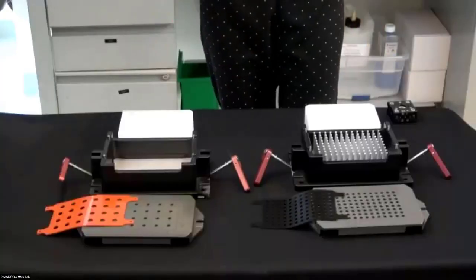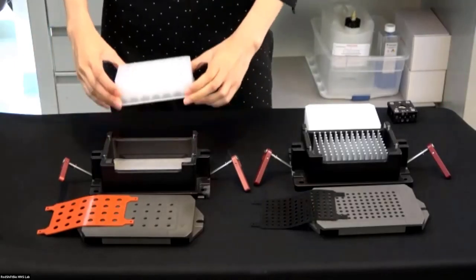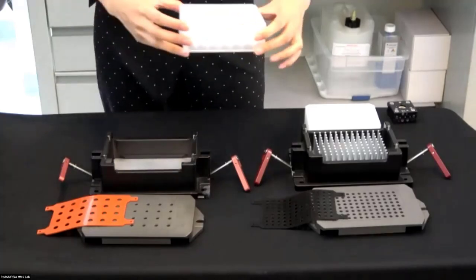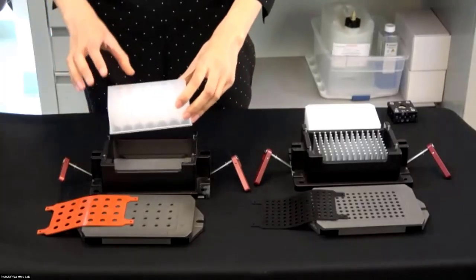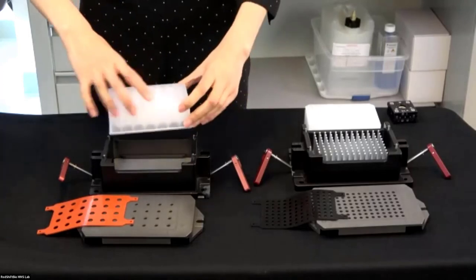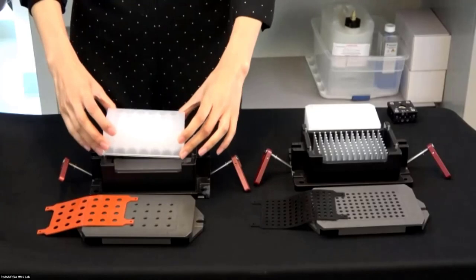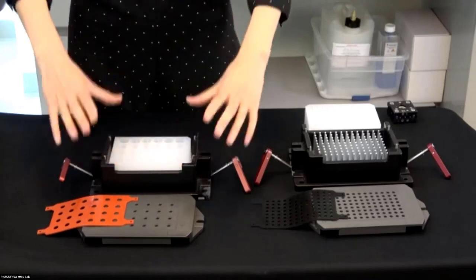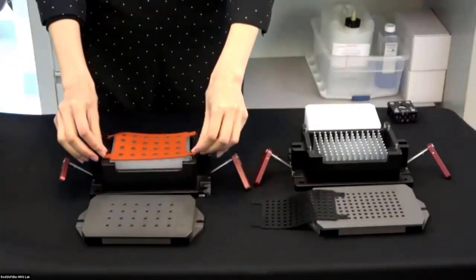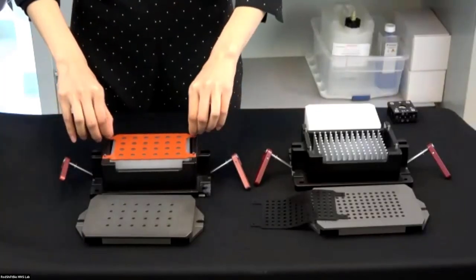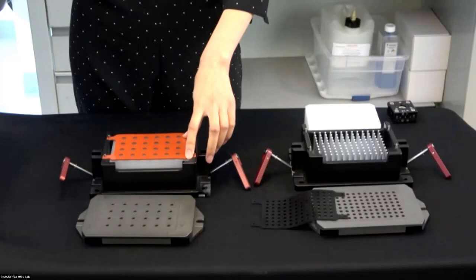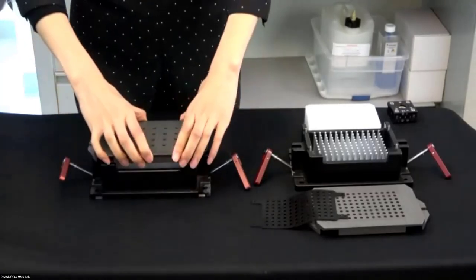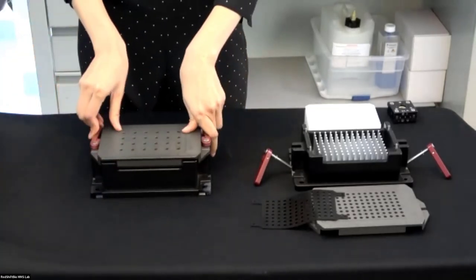Here, let's move to our magician's table. Since it's a magic table, the sample has been magically loaded into the plate. Now what we need to do is just to put the plate into the carrier and you don't have to worry about the orientation. If you don't put in the right orientation it's not going to fit. Put in the plate and then we're going to put a rubber gasket, because we're using lab grade inert gas to push the liquid into the flow cell. We need to give it a good seal and then put the metal cover on top. And that's it.